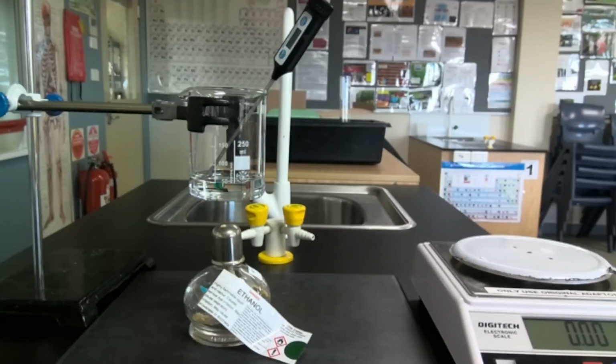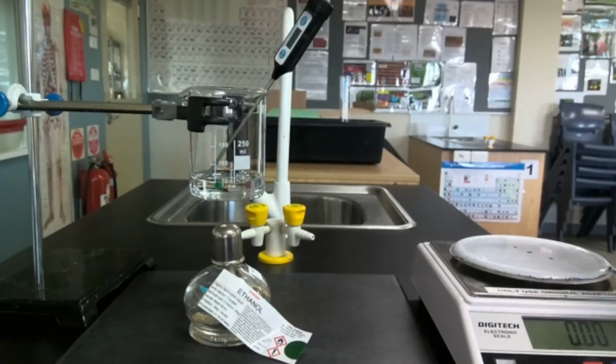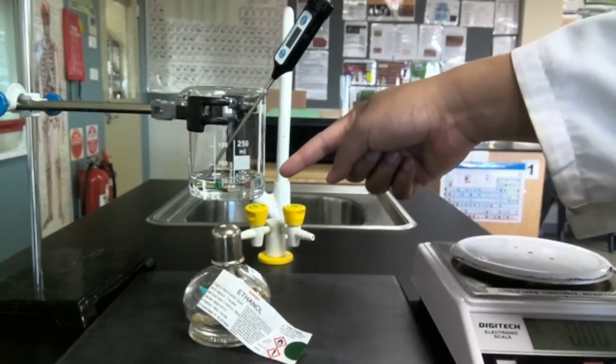The way that we do this is through a process known as calorimetry. In calorimetry, because we can't directly measure the loss of energy of those compounds effectively, what we can do is measure their effect on their surroundings. And what we include as our surroundings here is just 50 mL of water.